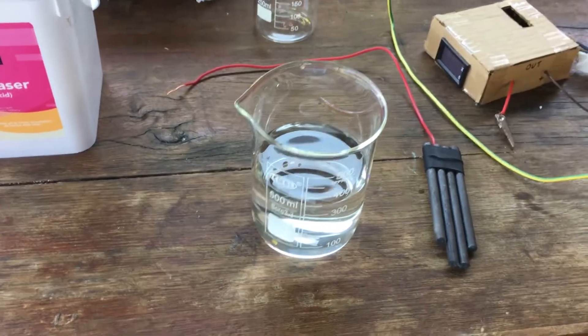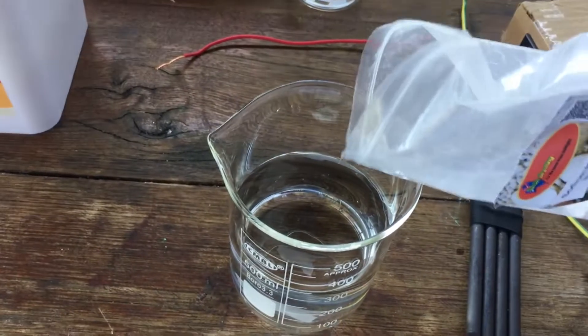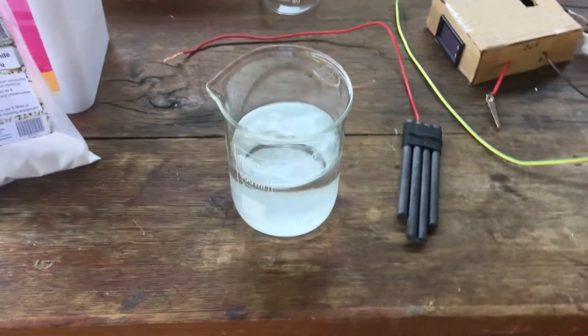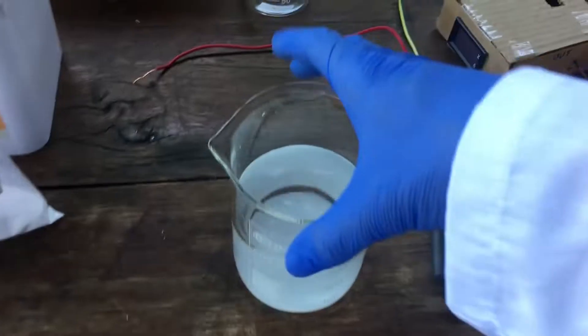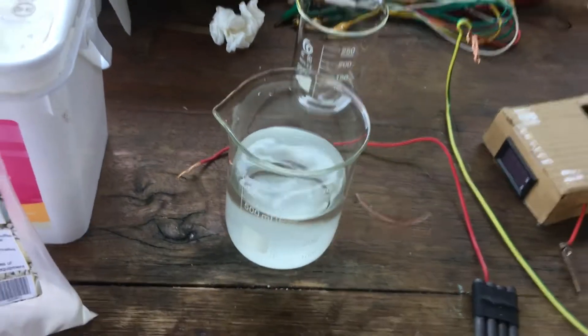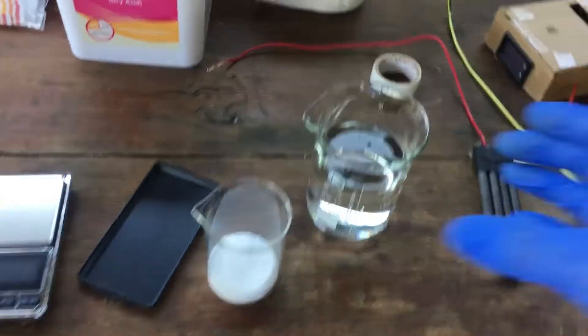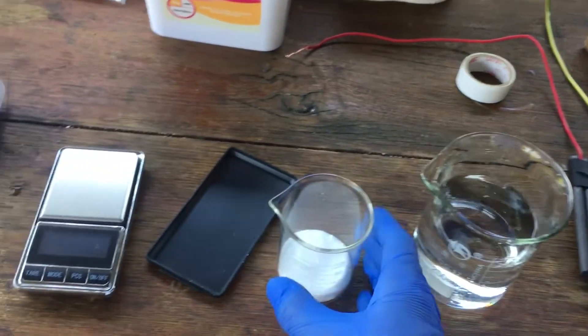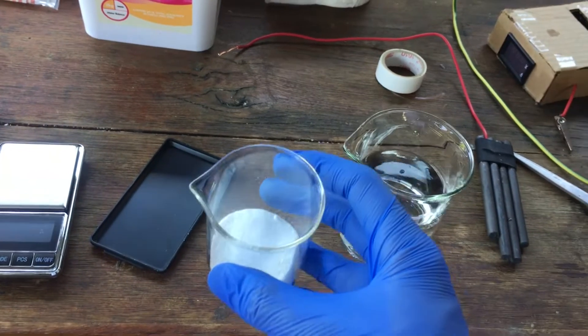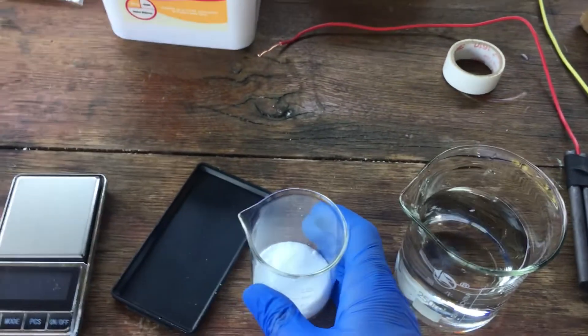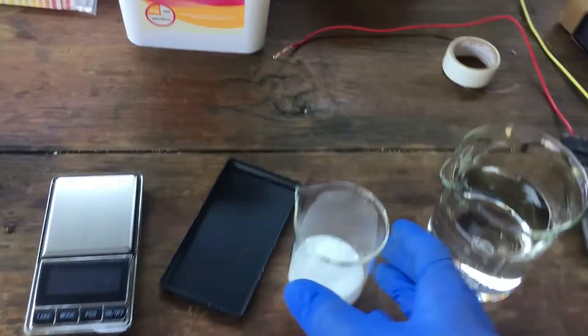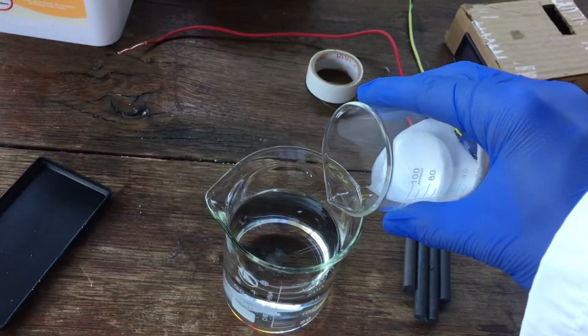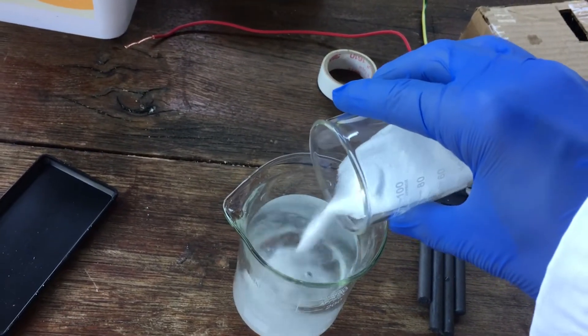It's probably a good idea to make up our neutralizing agent first. I've just added some amount of sodium metabisulfite. Hopefully, that should be good as our neutralizing solution for later. Now, next, I've got our 250 milliliter beaker for the electrolysis cell, and I've measured out about 48 grams of our sodium bromide. By my calculations, this should be enough, if our yield is 100%, to generate about 12 milliliters of elemental bromine. So, I'll just go ahead and add that straight in.